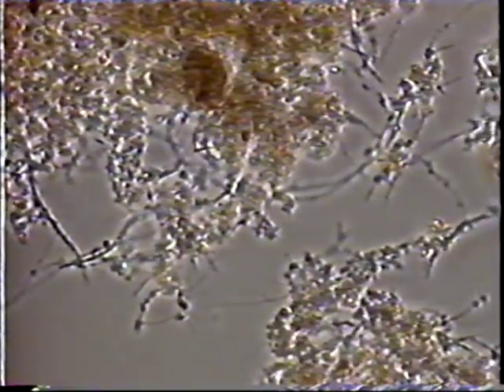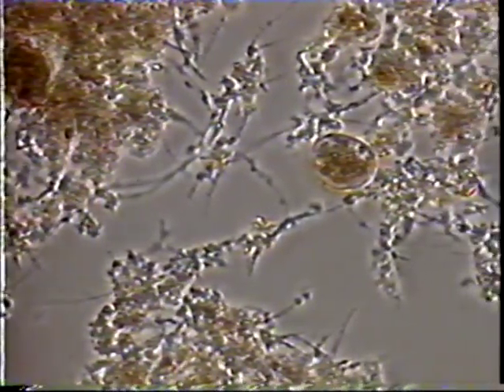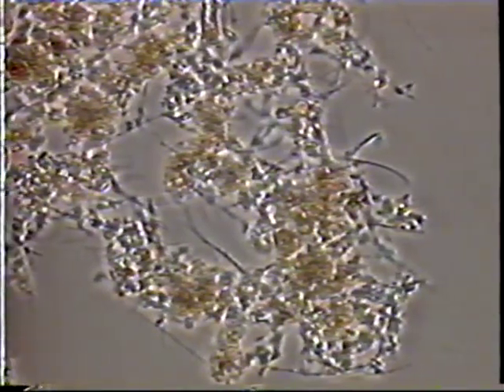Shown together are types 1851, 0675, and 0041, all indicators of a low food-to-microorganism, or F/M ratio. These cause both interfloc bridging and an open floc structure. Note that there are 3 types of filaments present, differentiated by diameter: thin, medium, and thick.